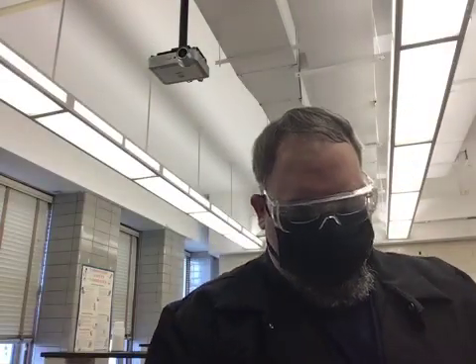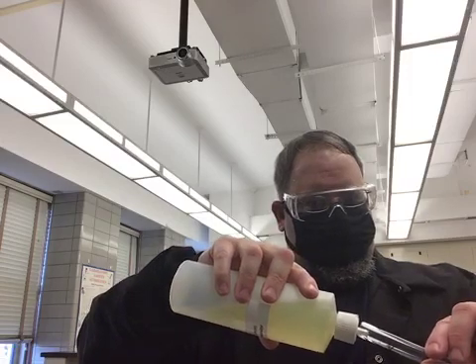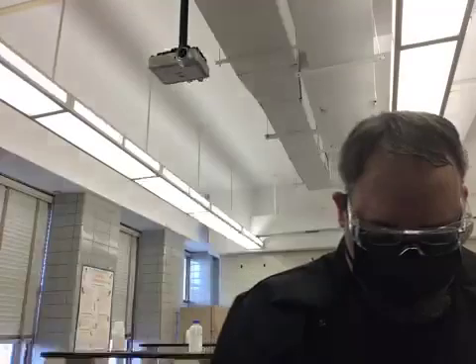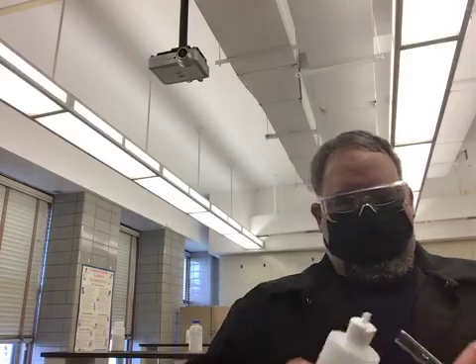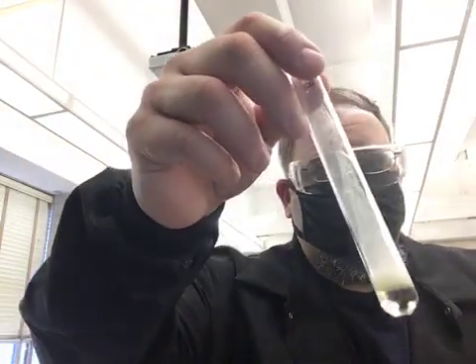Let's take unknown A. Unknown A. Let's add a couple drops. There's our result. And then finally, let's take unknown B, and a couple drops. And there's our result.